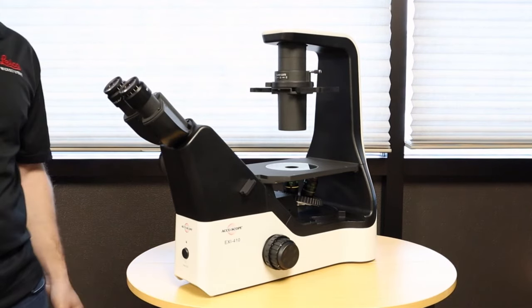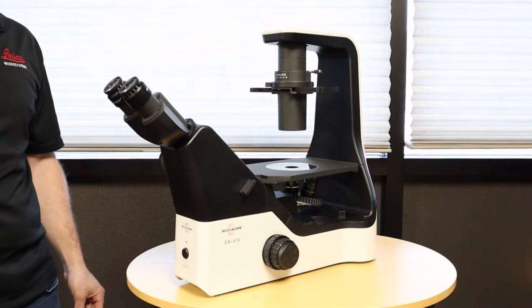That's a quick assembly video for the Accuscope EXI-410 microscope. For any questions you can reach us at Microscope Central.